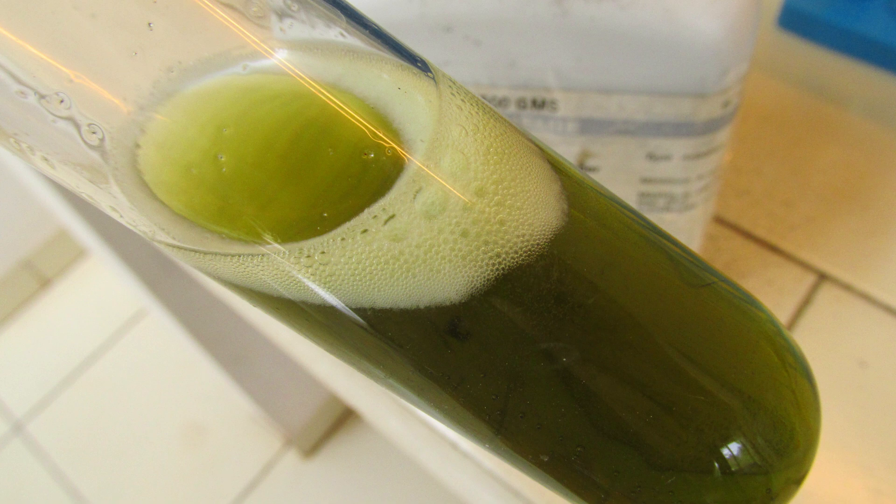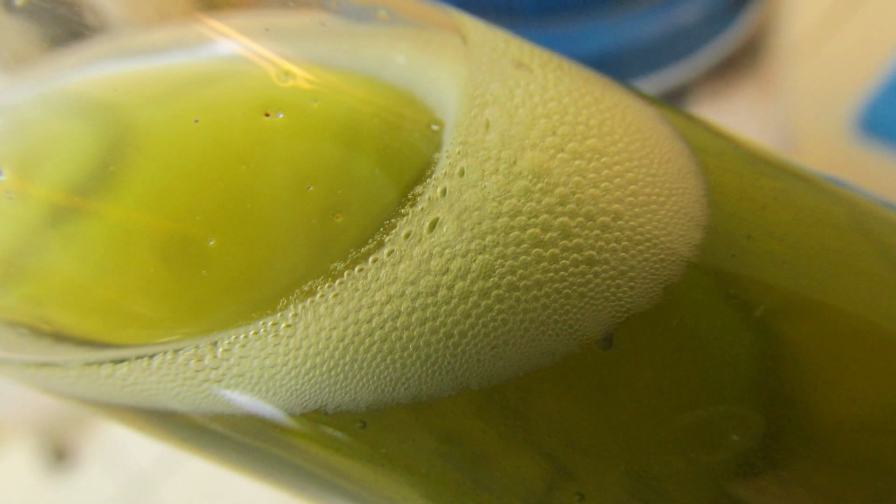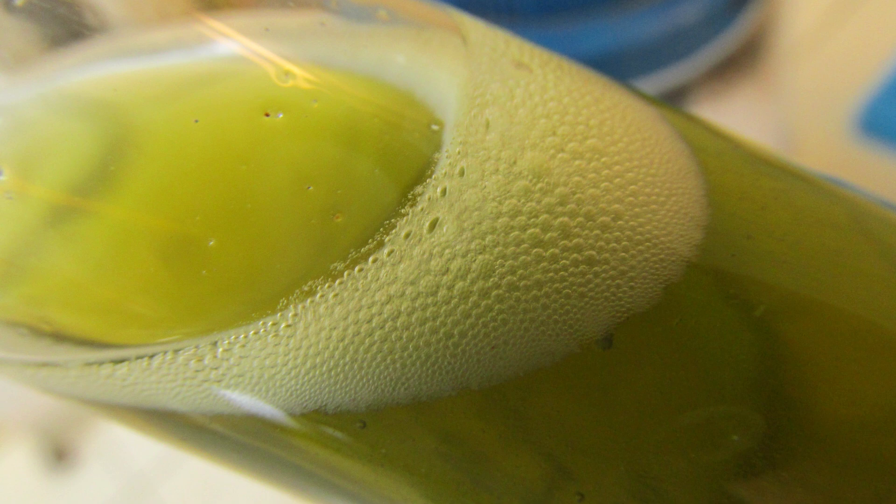Here is the green color. It's reduced with magnesium powder into nicely-looking green chromium 3.